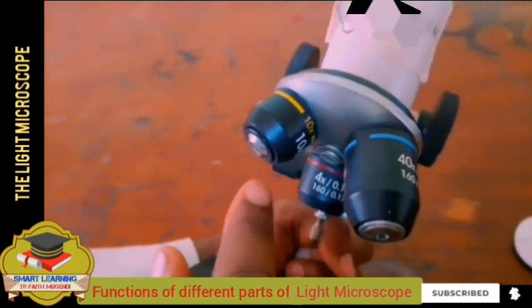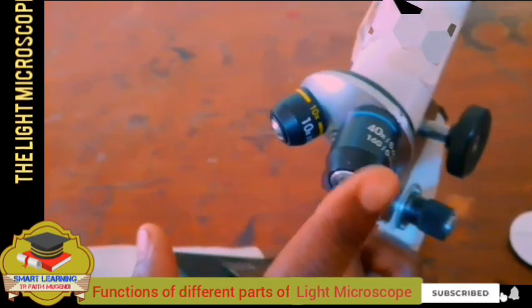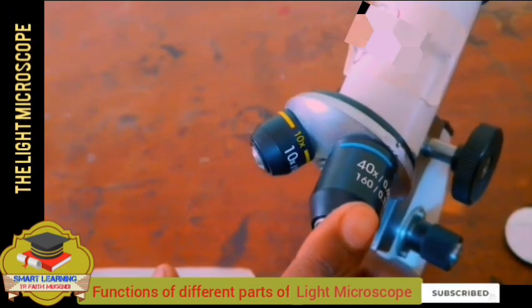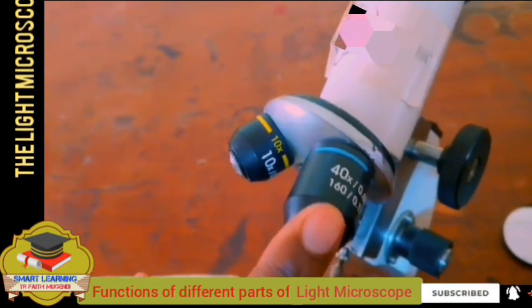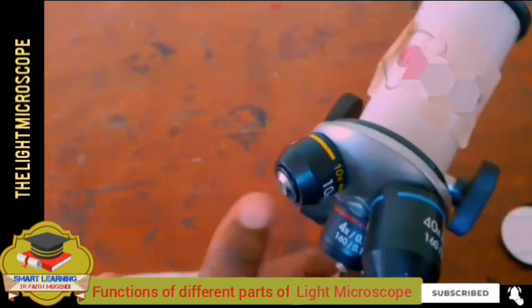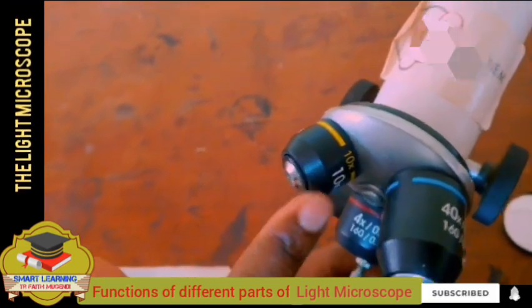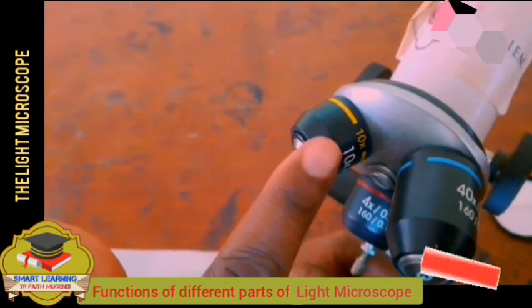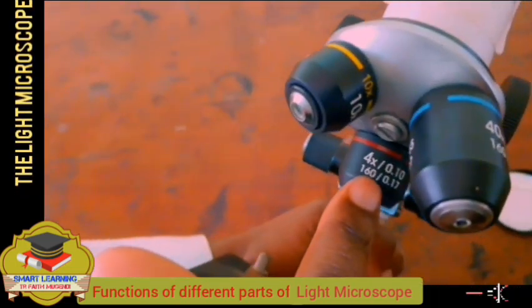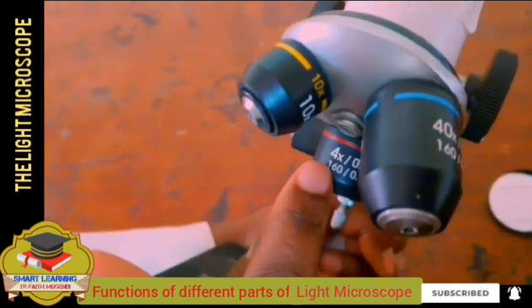They have different magnification, and this one has the highest power of magnification. This one magnifies the object 40 times. So whatever you see is usually magnified 40 times. For times 10, it is the medium objective lens that magnifies the object 10 times, and the low power objective lens magnifies an object 4 times.